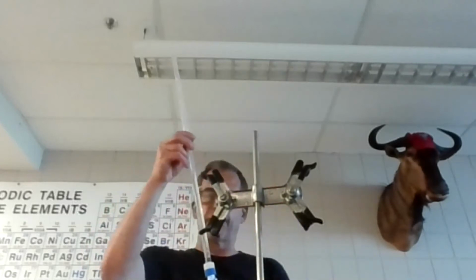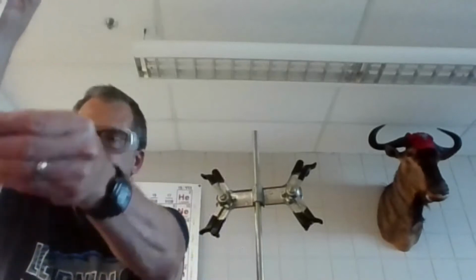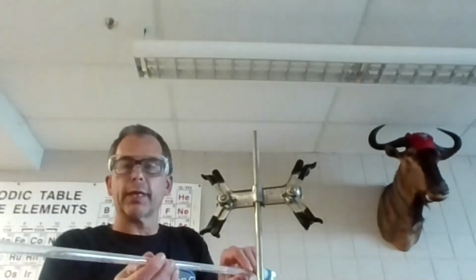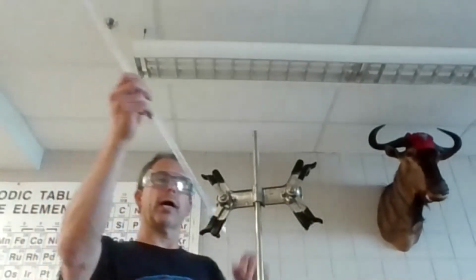So this is about half full. I don't know if you can see that. I might run a little out the burette bottom. So I'm going to do that. I'm opening the burette, running it onto the table, and hopefully I don't spill there. And then I'm just kind of rolling this into the sink so that it meets all the parts of this right here. Okay, so now I empty the burette.